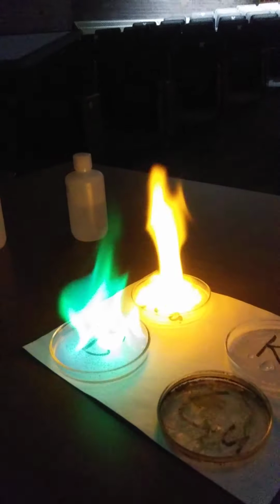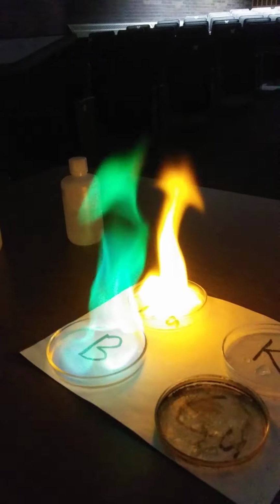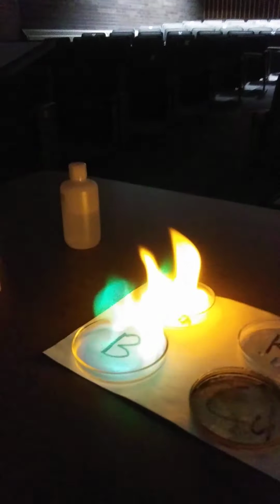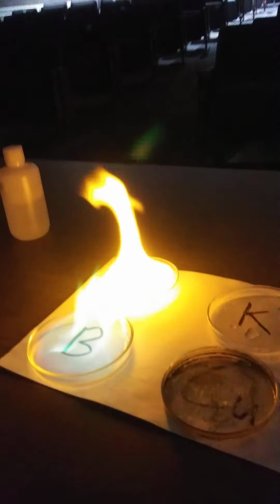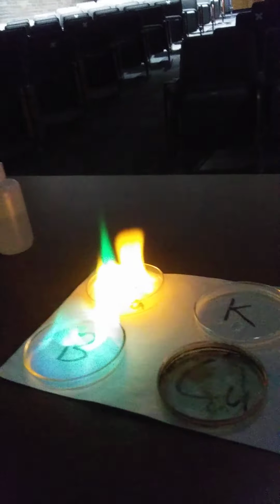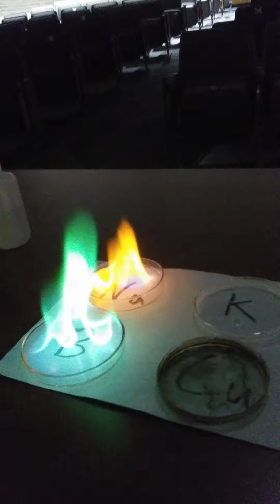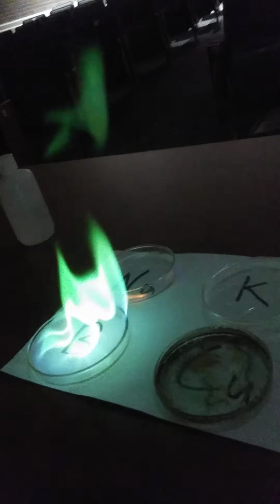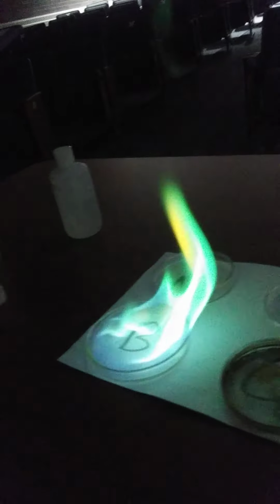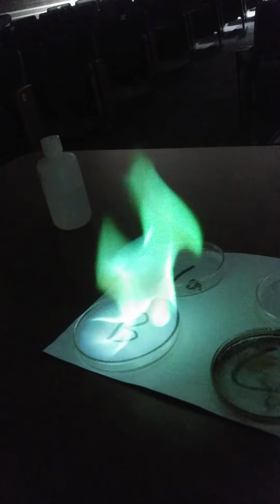I think you need a different kind of camera to be able to pick up the true colors. I'm just seeing a lot of white. All right, well, I'll post this and then we'll talk about the different energy levels that are involved and how you can identify metals based on this interaction between electromagnetic radiation and the atomic orbitals in atoms. I'm just going to let it burn out, see if the boron will, kind of see a little green there. Nothing like in person, though, I hate to say.